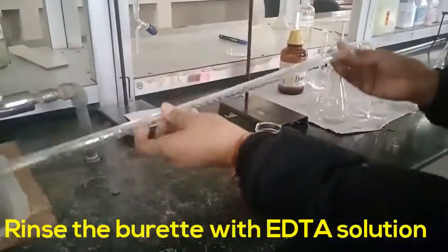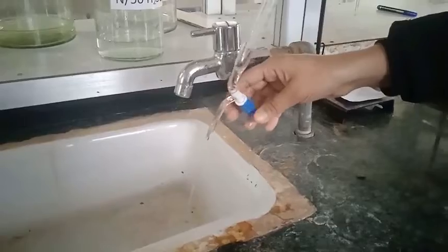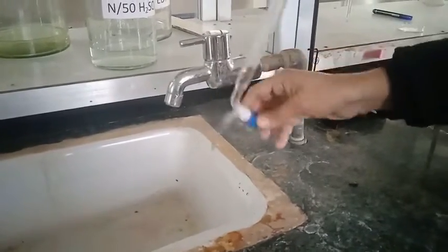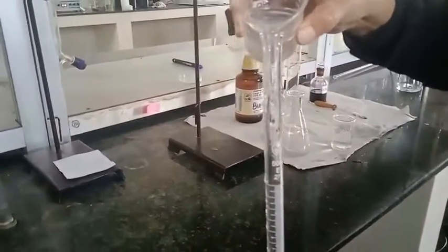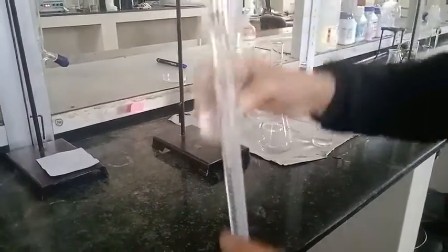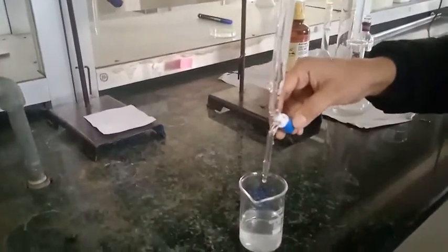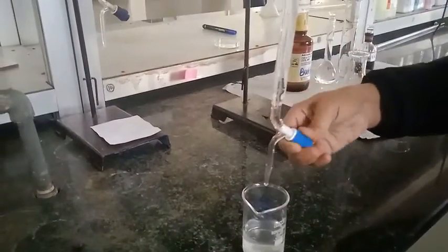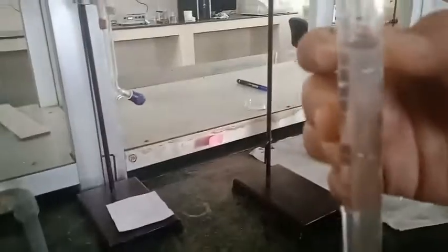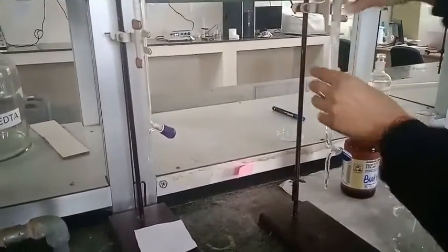First I am going to rinse this burette with EDTA solution. Now I am going to fill the EDTA into the burette — this is more than the zero point, just because I want to fill the nozzle also. And now I clamp it.